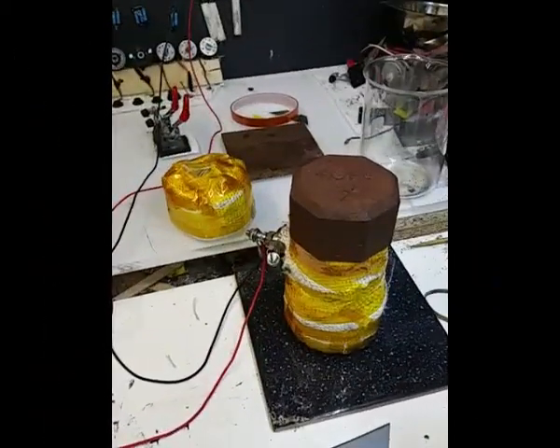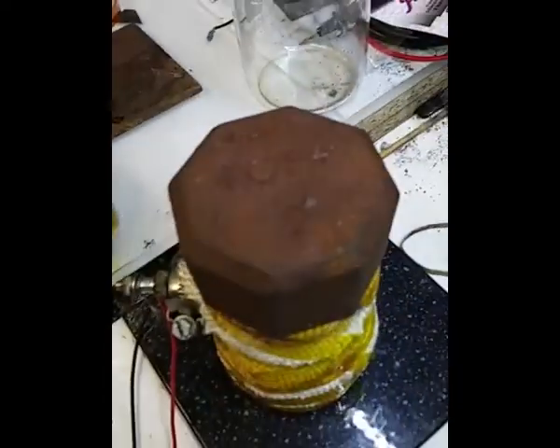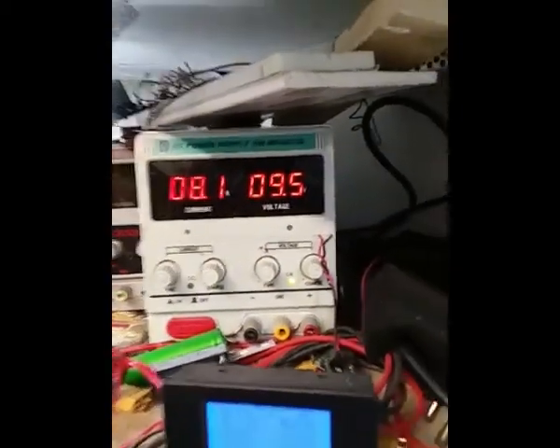Okay, so we're back on the bench. I've just put that fluid back in there. I've hooked it back up. I've turned it up to 9.5 volts and we've got 8.1 amps at the moment.